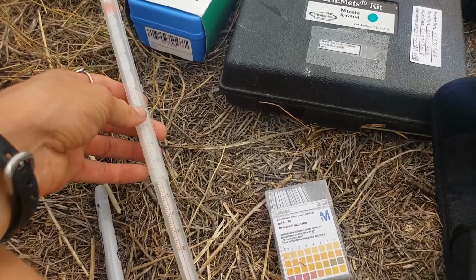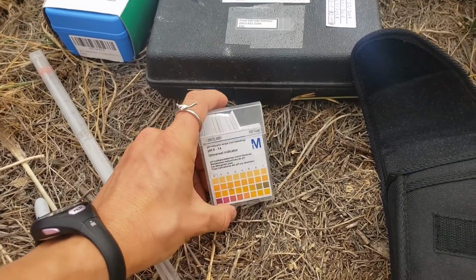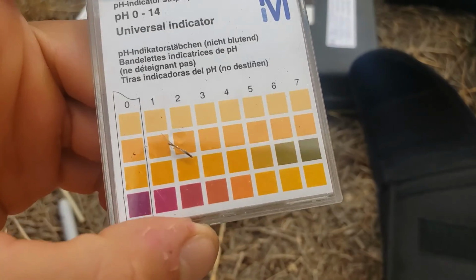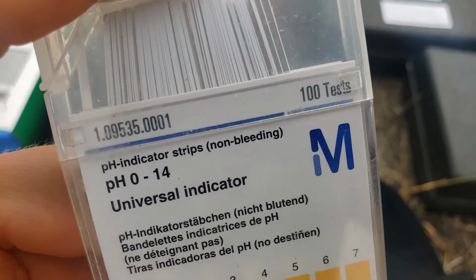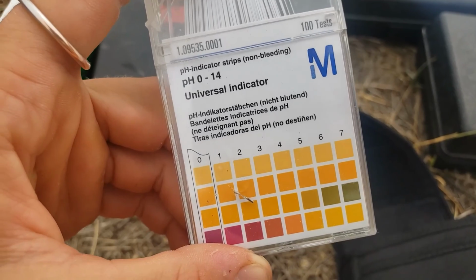Okay, so let's go ahead and measure the temperature. Let's go through our tools first. Temperature, we can measure pH. So one thing we might find, well, let's just leave this up to exploration. There's lots I can tell you about how all these variables interact, but that's the fun of going out and measuring these yourself, so you can see the relationships here.